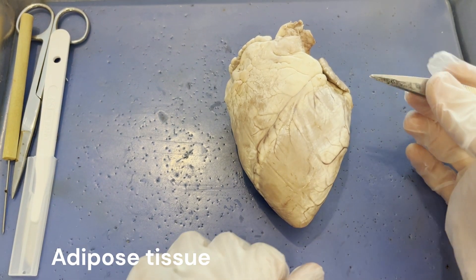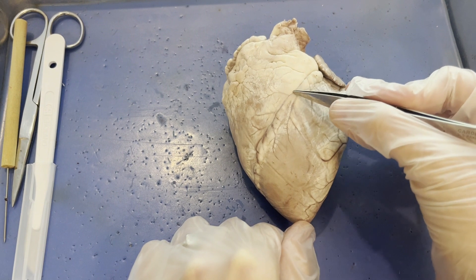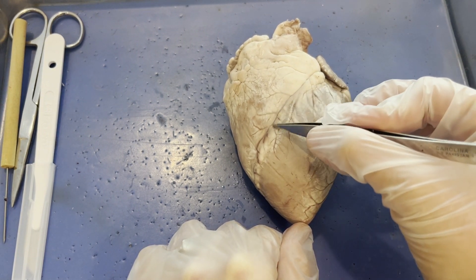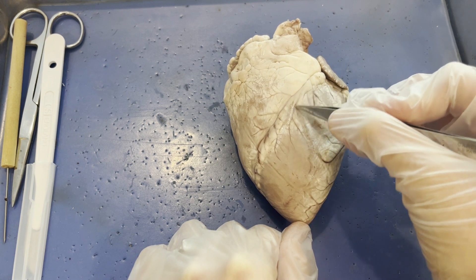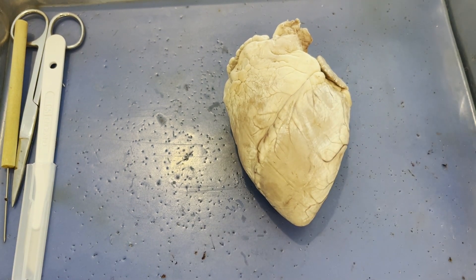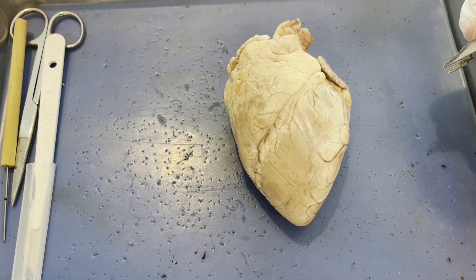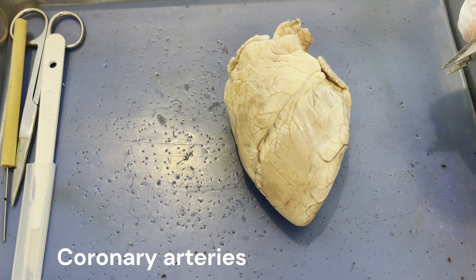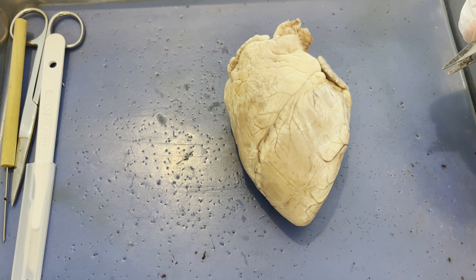Another feature to notice on the heart are almost like these river delta branches coming down the heart. These are actually blood vessels embedded inside that adipose tissue. These are a special type of blood vessel known as coronary arteries, and their responsibility is to deliver blood to the heart itself.